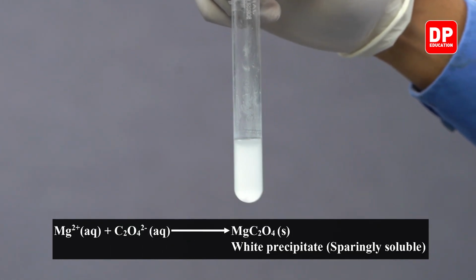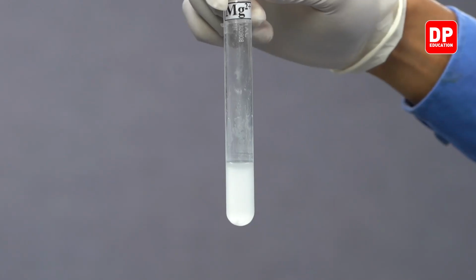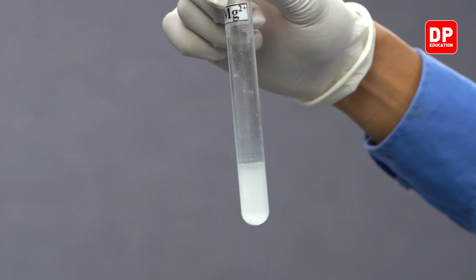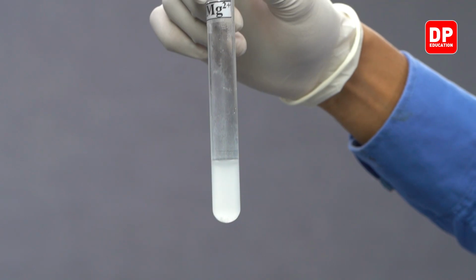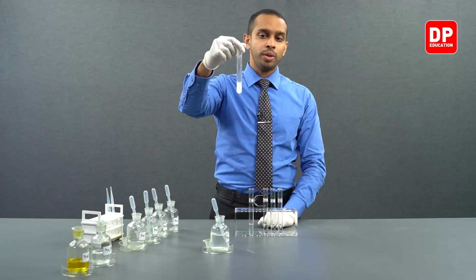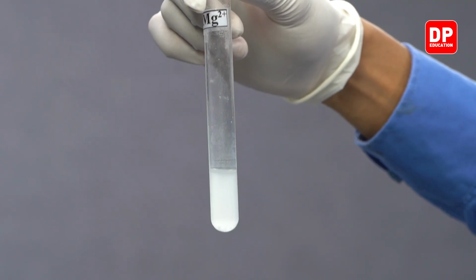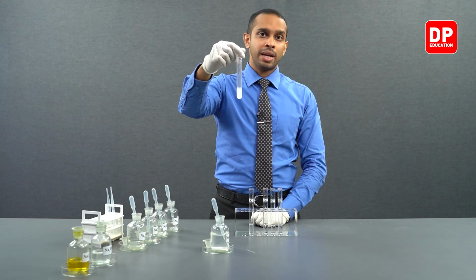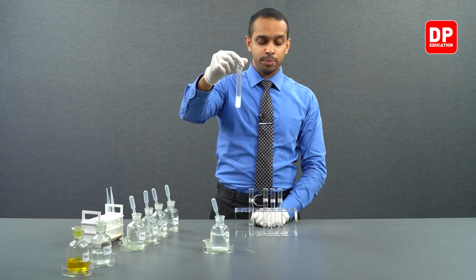Magnesium oxalate is a white color precipitate and it is sparingly soluble in water, which means a certain amount of the magnesium oxalate precipitate that was formed here dissolved in the aqueous medium, and the remainder can be seen as fine precipitate particles that are dispersed or suspended throughout the aqueous medium, making this aqueous medium look cloudy. So with the presence of oxalate anions, magnesium 2+ will form magnesium oxalate, which is a white color precipitate.